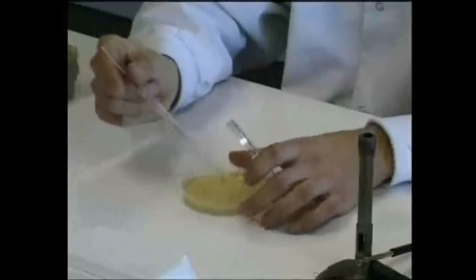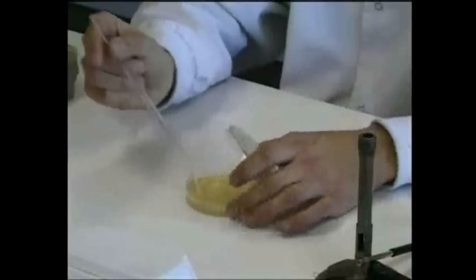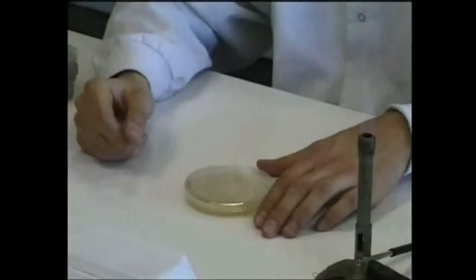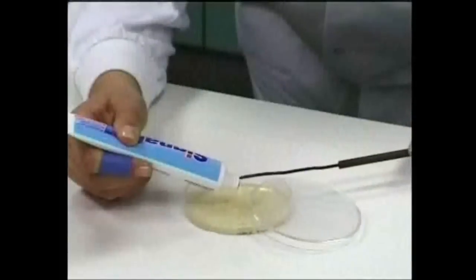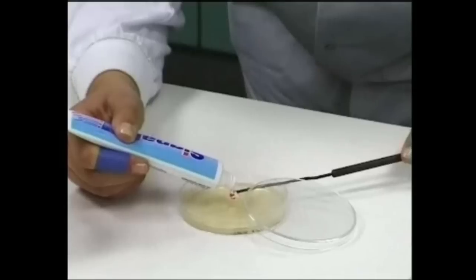When the spreader has cooled, it can be placed lightly on the surface of the agar. The dish should be rotated whilst the spreader is moved up and down and across the medium. Once the lawn has dried, reagents can be added to measure inhibition of growth.